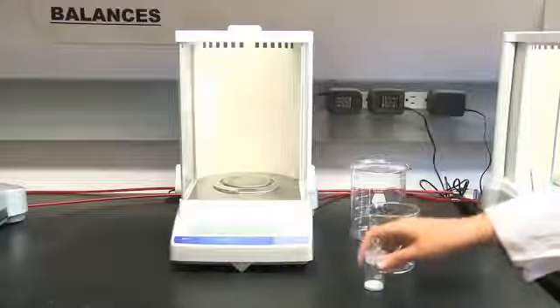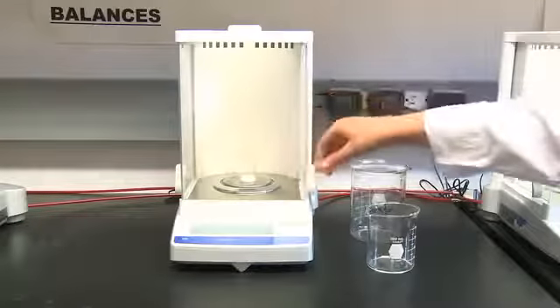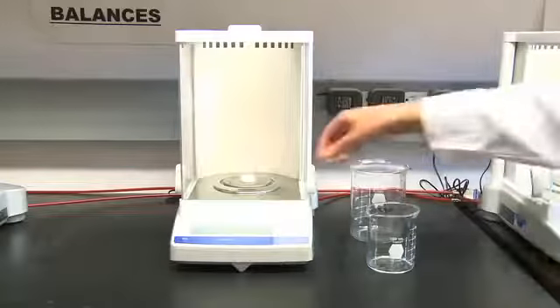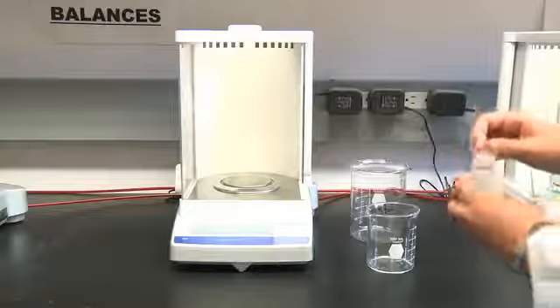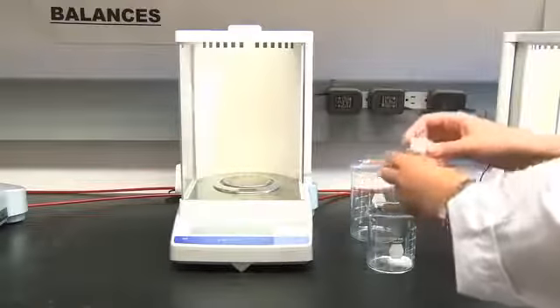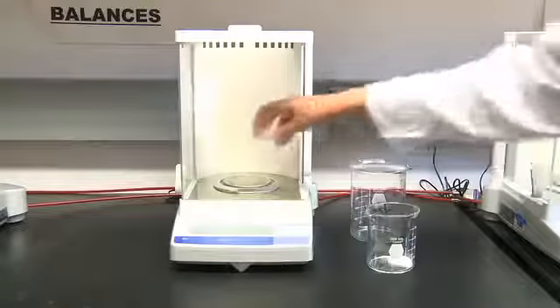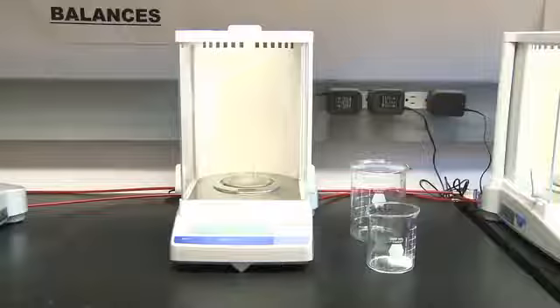The first step is to weigh out your solute. Do this using the same technique shown to you in the analytical balance video. Once you've recorded the initial mass, empty your sample into a beaker. I'm using a 250 milliliter beaker because I'll be making a 250 milliliter sample. Now weigh your empty vial and record the final mass. Use the difference between the initial and final mass to get the mass of your sample transferred.